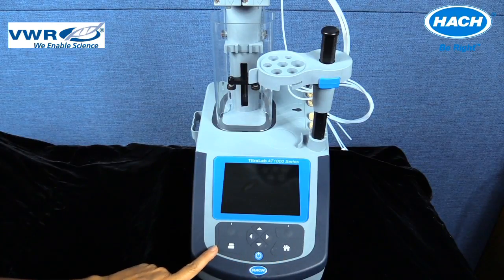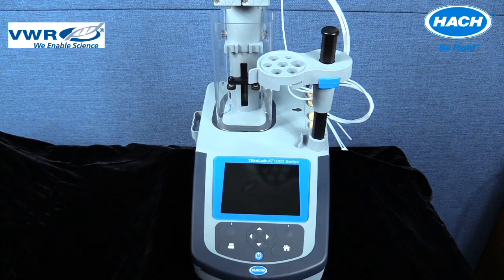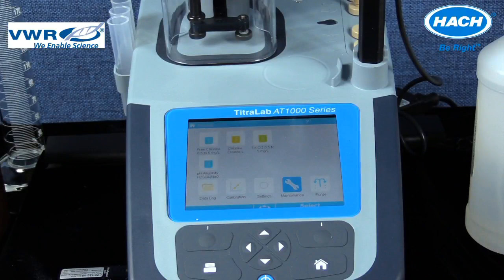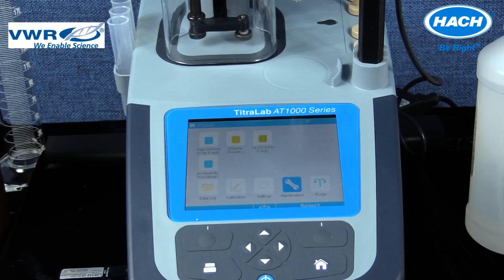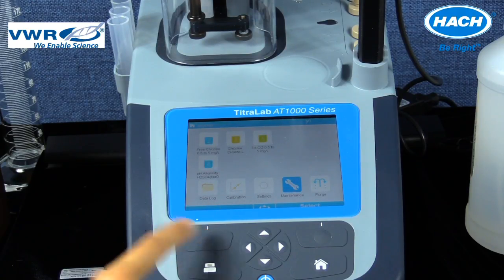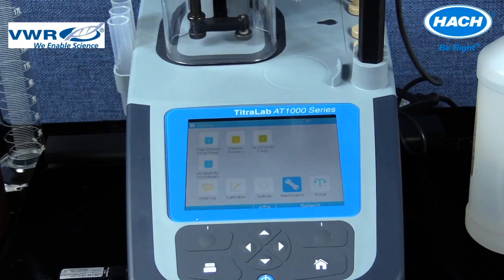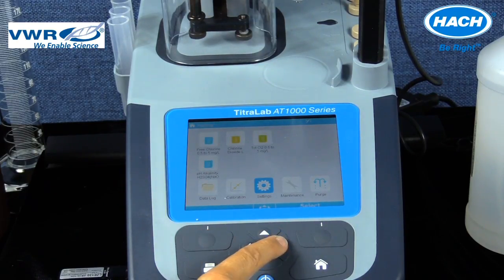By pushing the home key, the software will go directly to the main menu. Selection keys or soft keys are used to select options shown above the soft keys in the blue bar. The options available are applicable to the current operation in the software. This key is also used to exit the current menu display or open submenus.